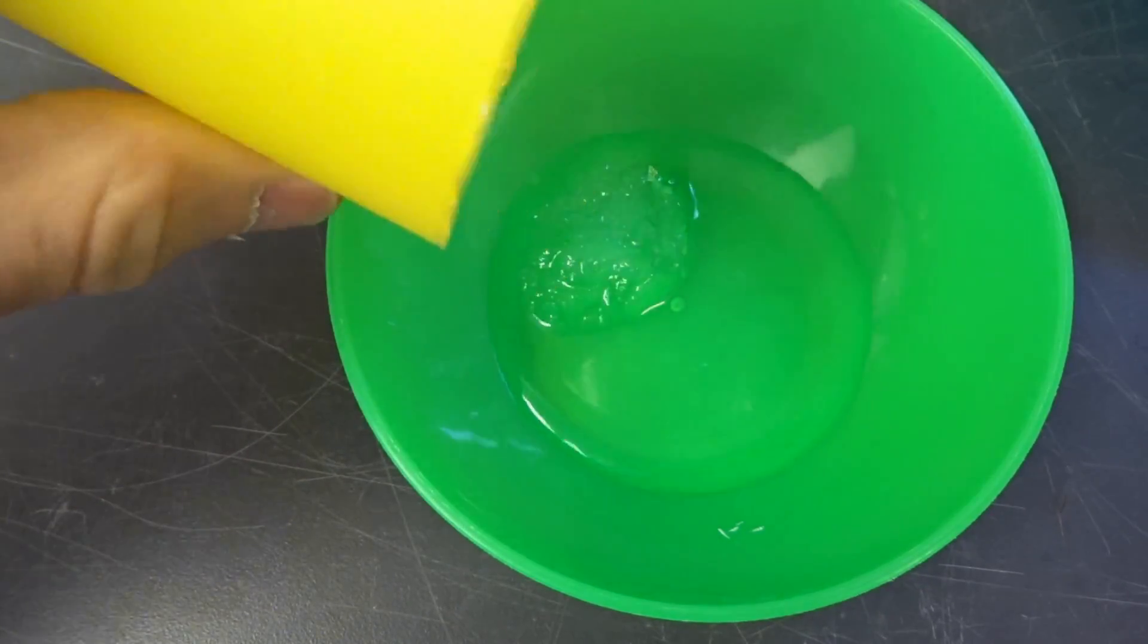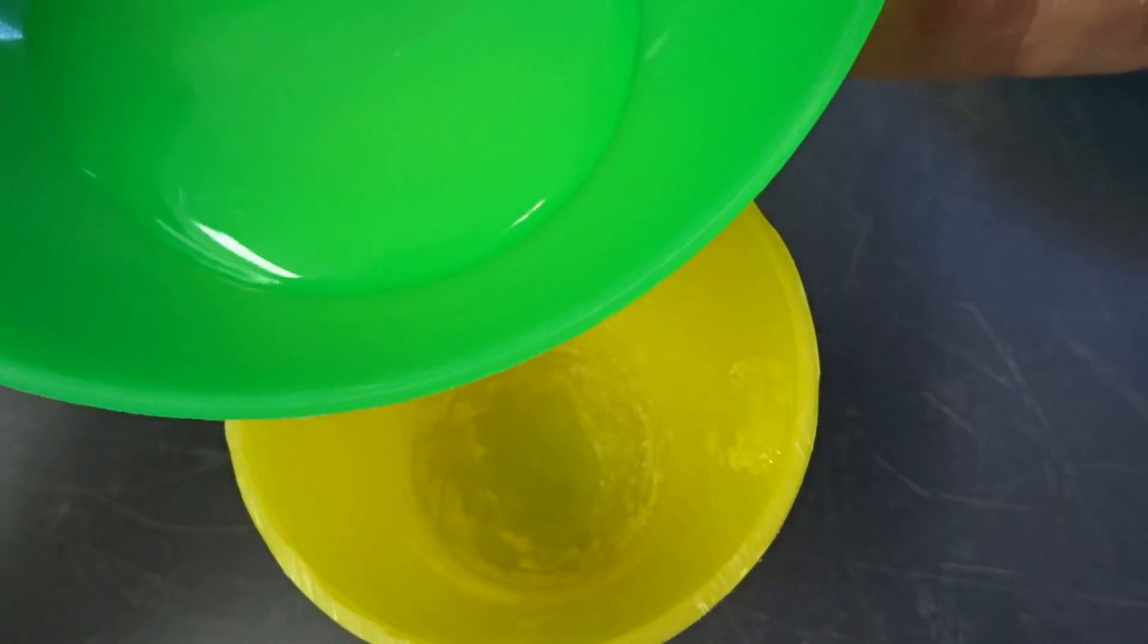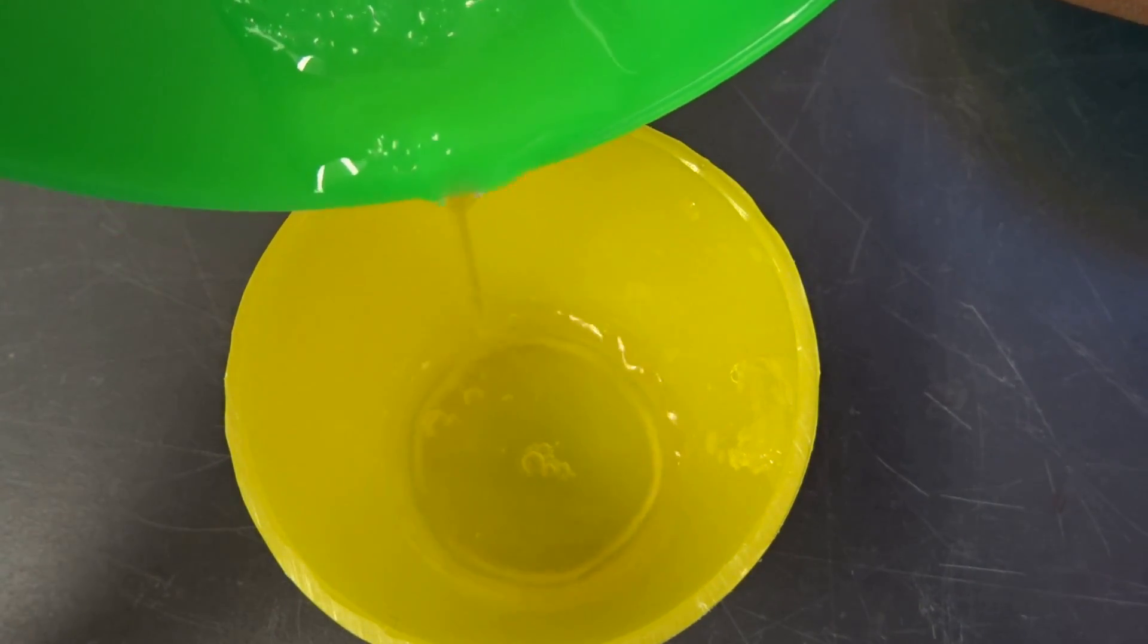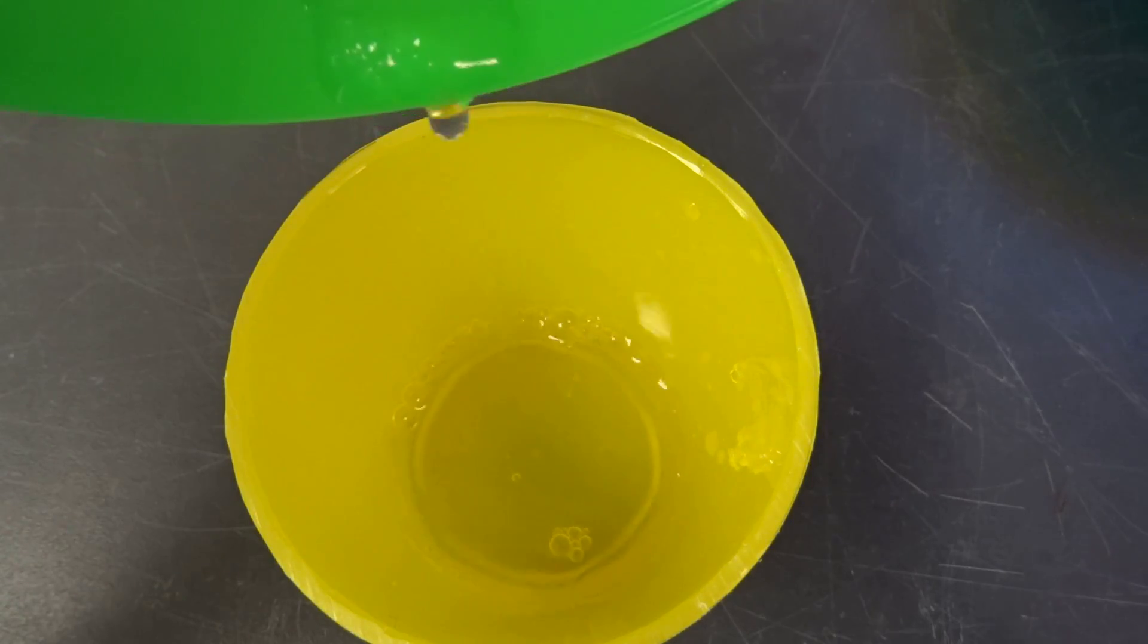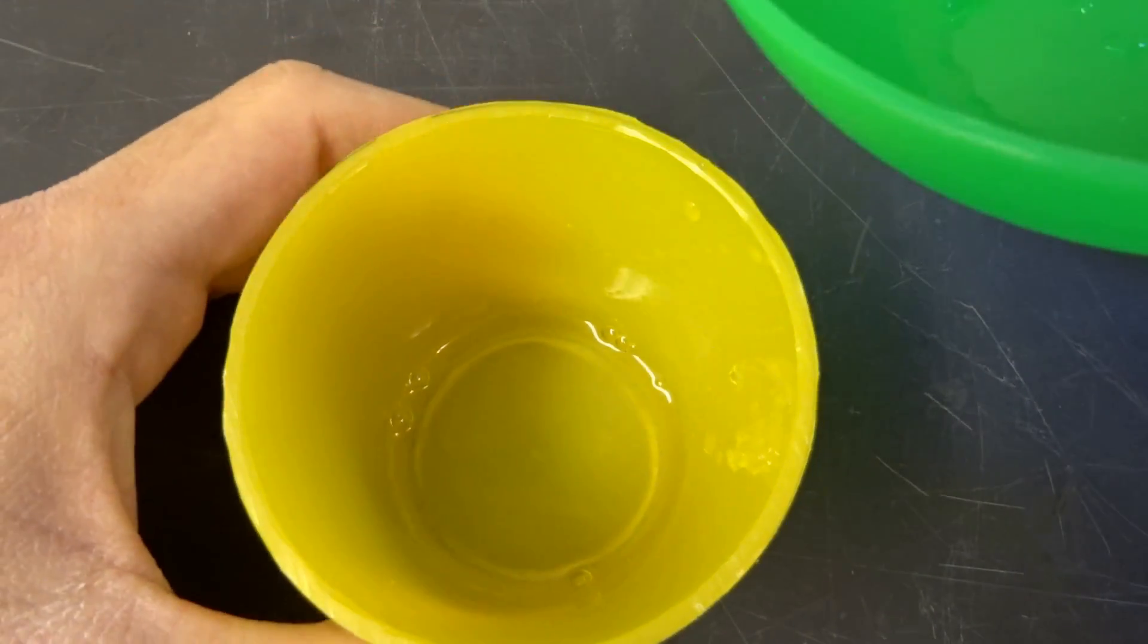And there was some water surrounding them. Usually your whole water in there should be gelled, but it's pretty hard to achieve this. So I always had some layers of gel surrounded by water, which I then poured off. But maybe I'll try to do this better for the next one.